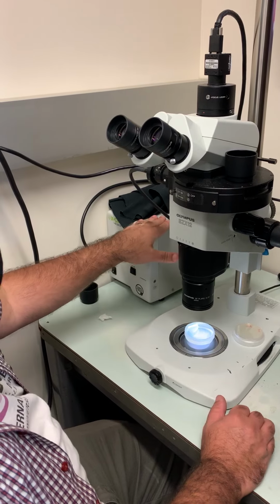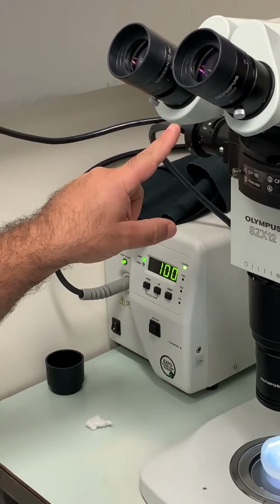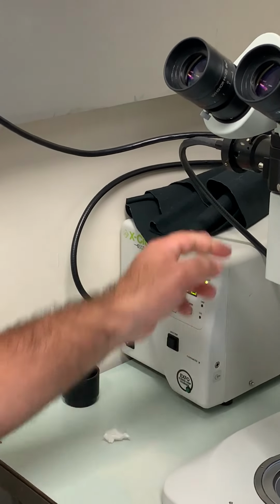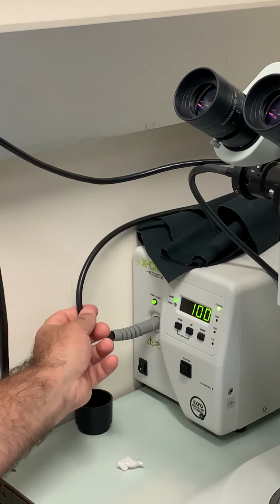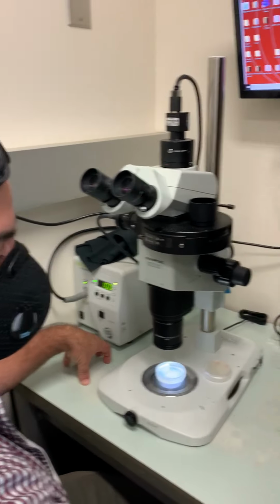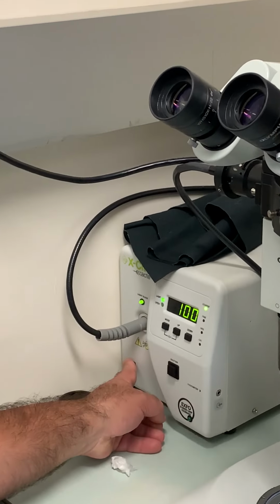Now if you're going to do calcium imaging, you're going to need a light source. This cable here is a fiber optic. It's made out of glass, and you have to be super careful not to bend it because it's $1,000, and if you bend it, it breaks the glass. Never put an alcohol lamp in here. Keep your alcohol lamp on this side, and then you turn the power on here.